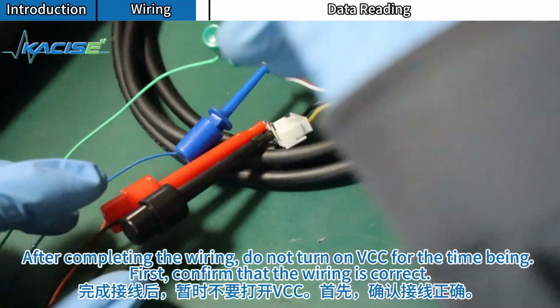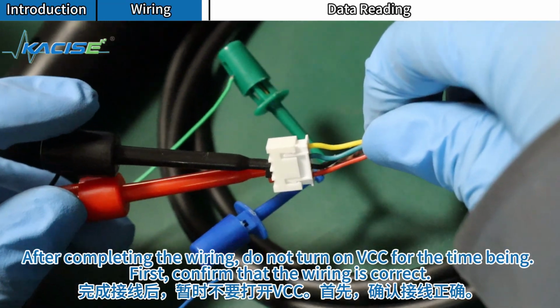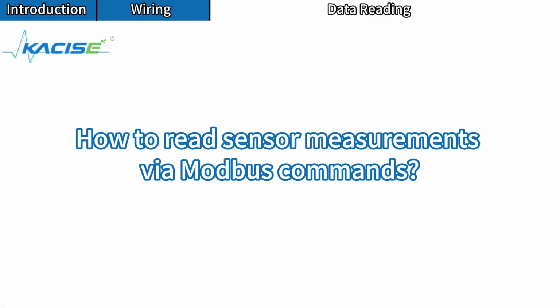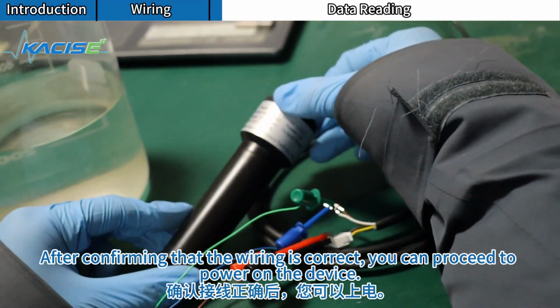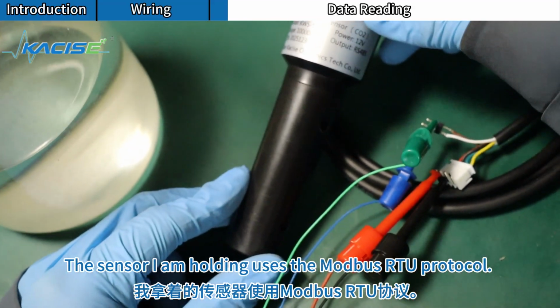After completing the wiring, do not turn on VCC for the time being. First, confirm that the wiring is correct. How to read sensor measurements via Modbus commands? After confirming that the wiring is correct, you can proceed to power on the device. The sensor I am holding uses the Modbus RTU protocol.